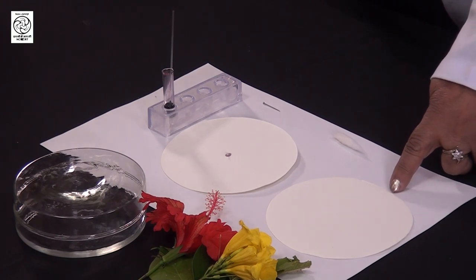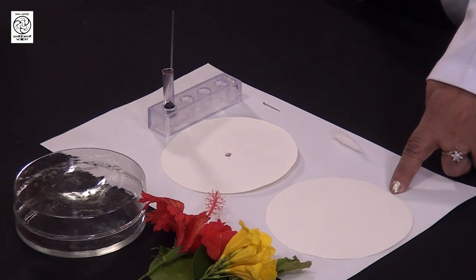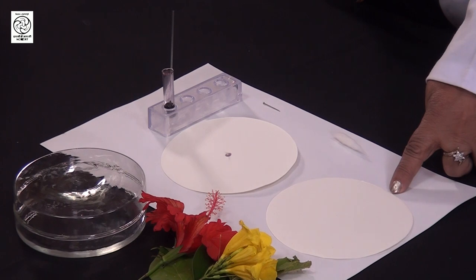Let us now do an experiment related to partition chromatography. Here we will use paper chromatography as an example. We have paper here and the mixture to be separated. After knowing the terms stationary phase and mobile phase, I have here this circular Whatman filter paper. Can you guess what will be the solid support or stationary phase here?